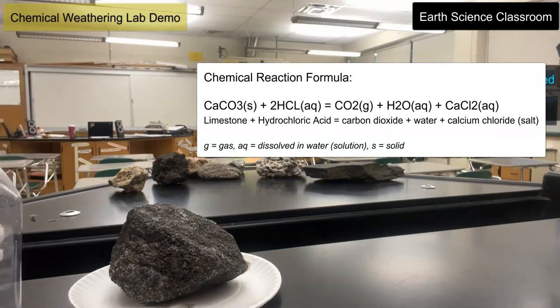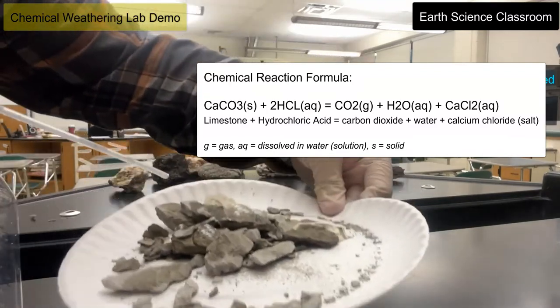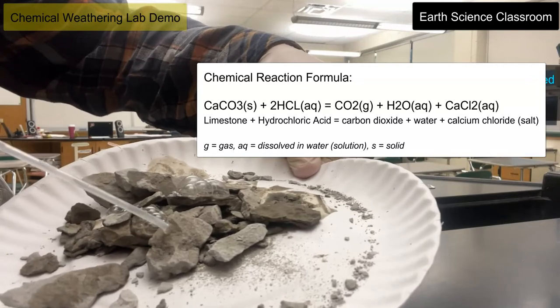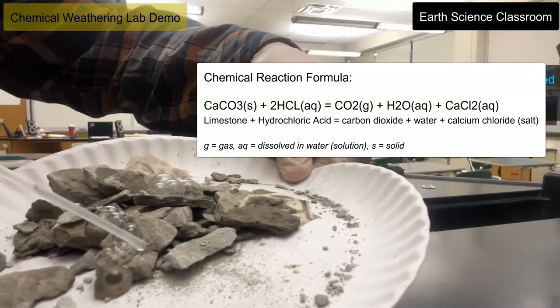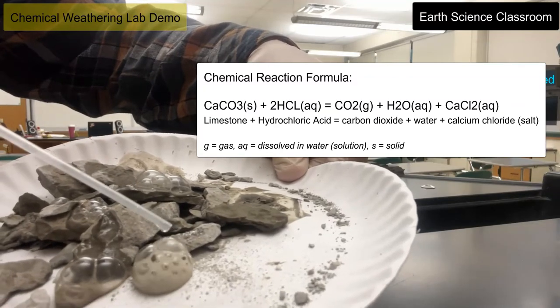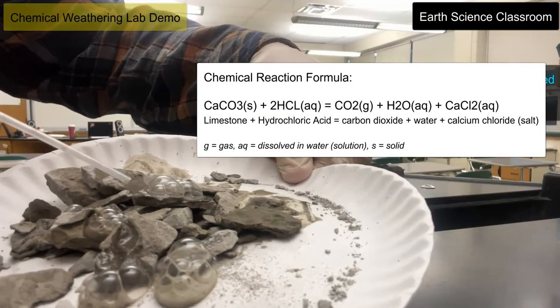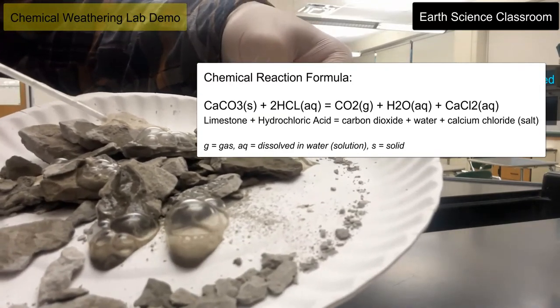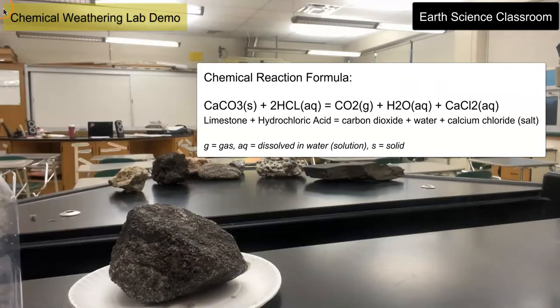You have some liquid coming off which is the water, and you have this beautiful chemical reaction between the hydrochloric acid and the limestone. Eventually, if you keep doing this, the limestone will actually start to dissolve, and the acid will create and form a new compound from the limestone and the acid.